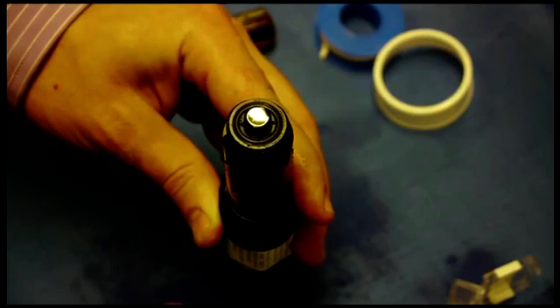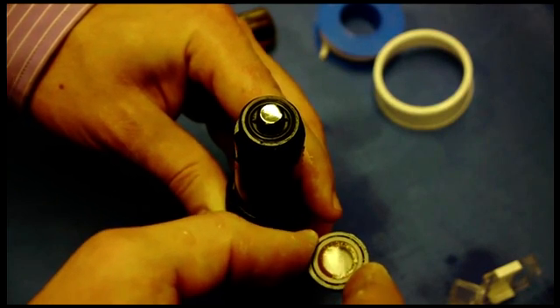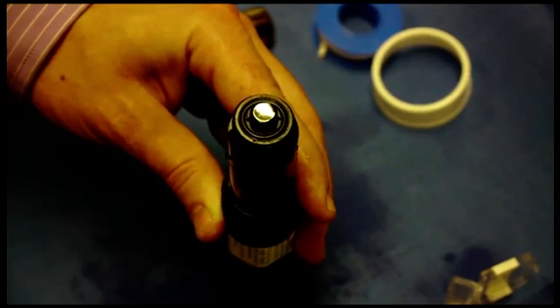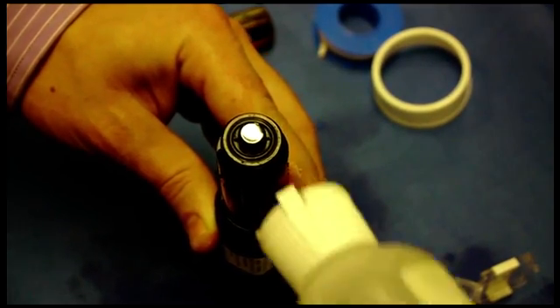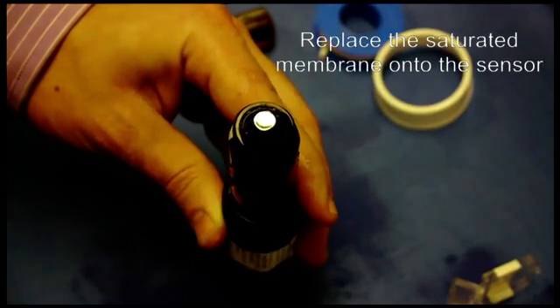Next I want to grab the membrane assembly which I've been letting soak this whole time. I want to get the electrolyte solution and pour it over the cathode and make sure it's completely drenched and saturated.